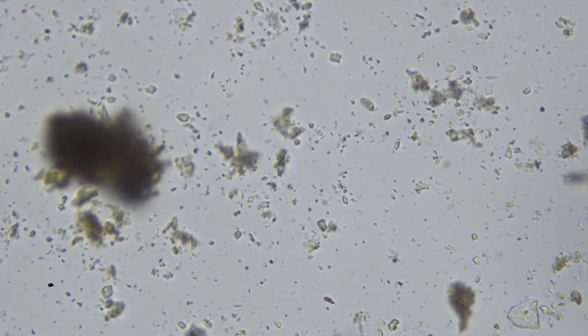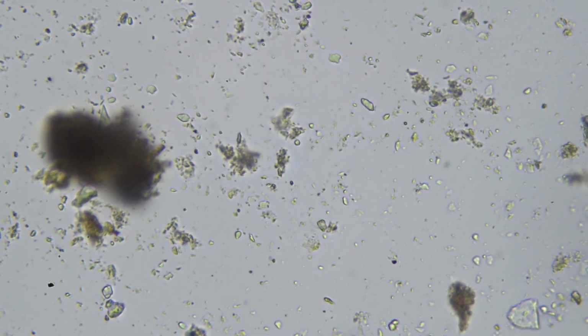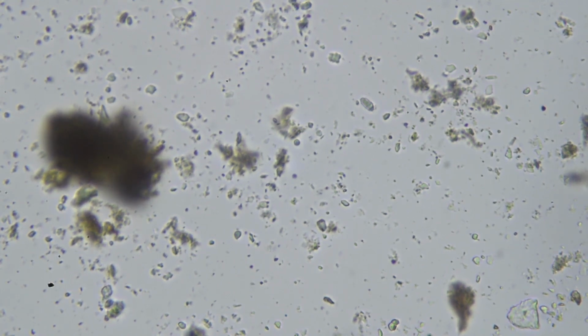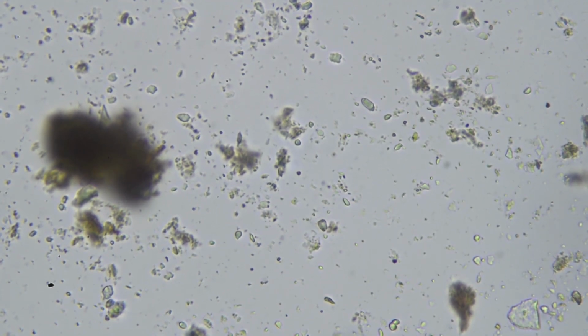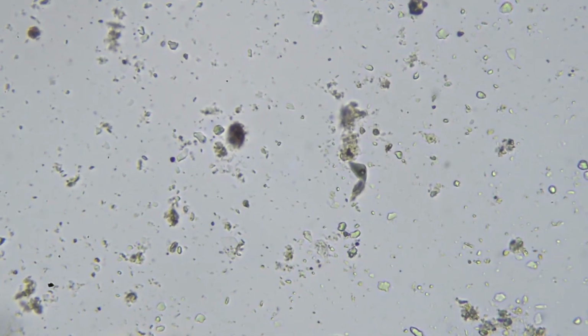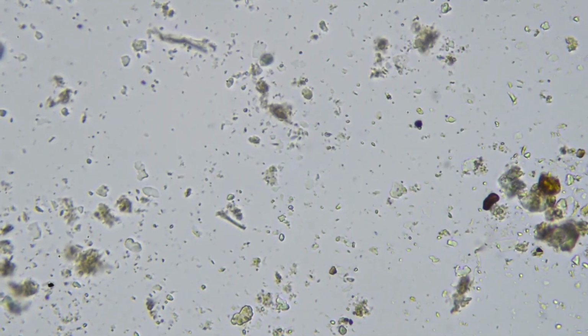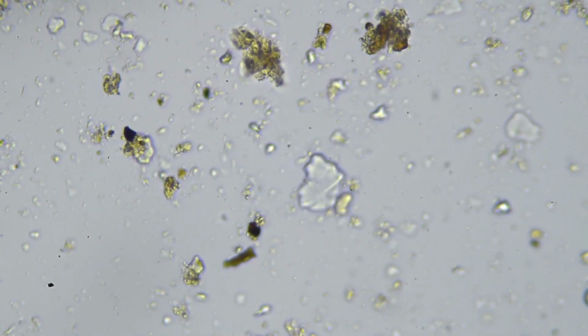So yeah, we're seeing some diversity in the bacteria. Certainly seeing cocci and a few bacillus, but apart from that, not too many shapes. No pathogenic fungi or bacteria though, so that's nice. Wouldn't really expect to see them though. That'd be very, very strange if we did.